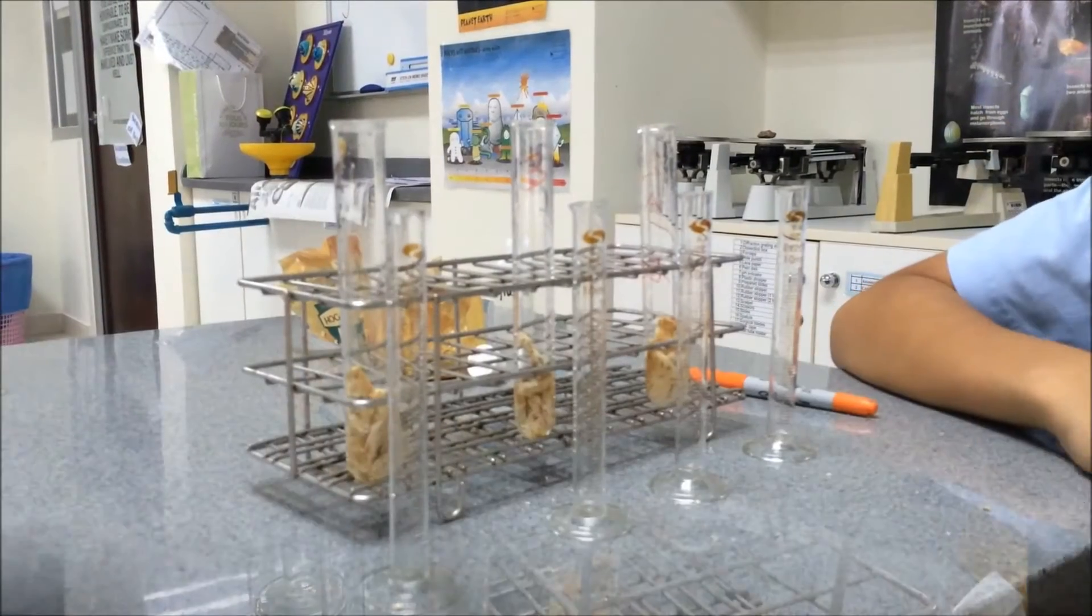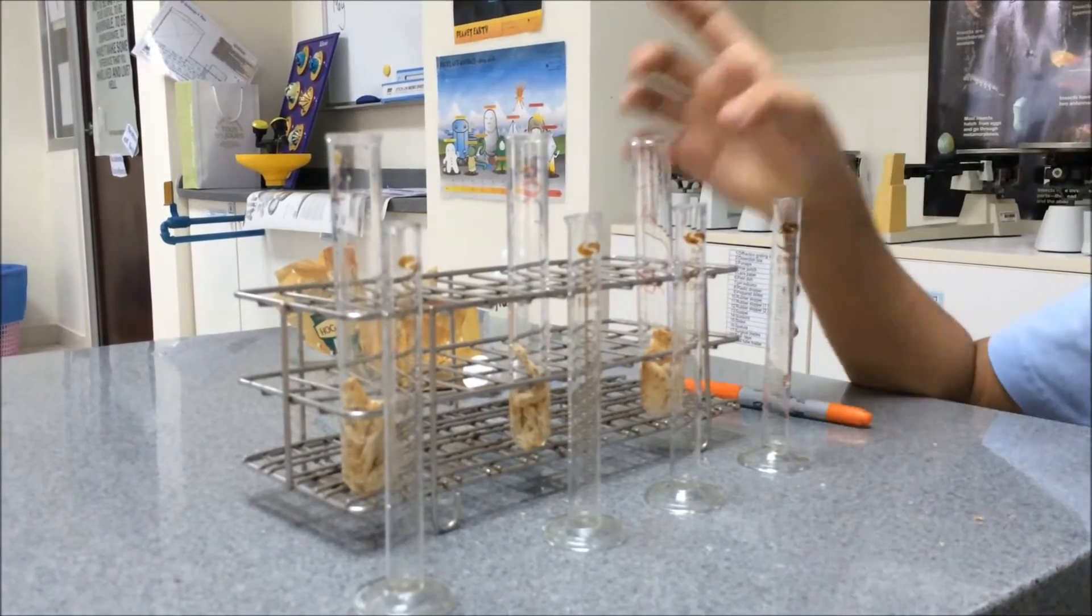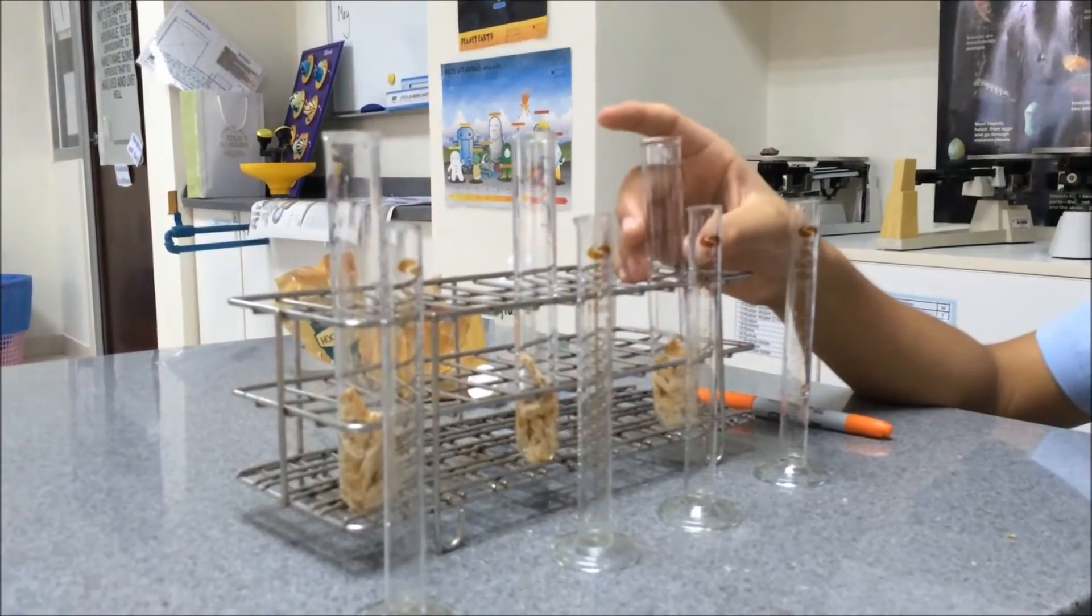Now we're going to wait until Monday and see which of the three tubes dissolves carbohydrates fastest.